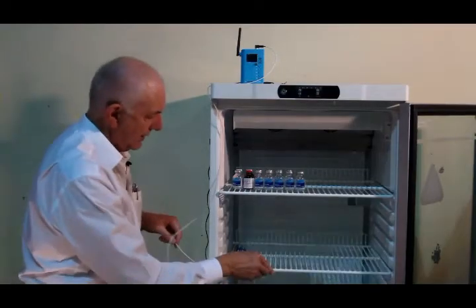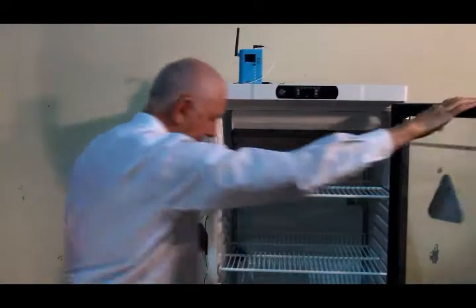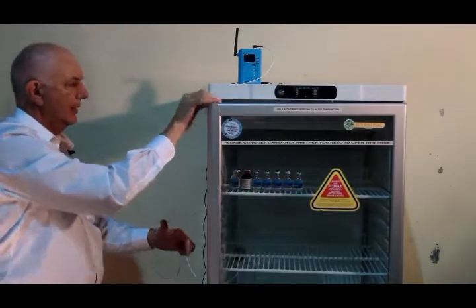Keeping the wire handy, close the vaccine fridge. This only takes a minute.